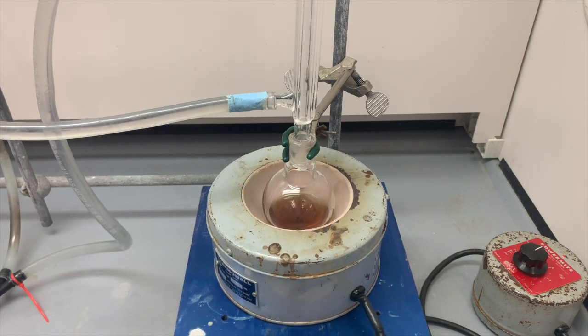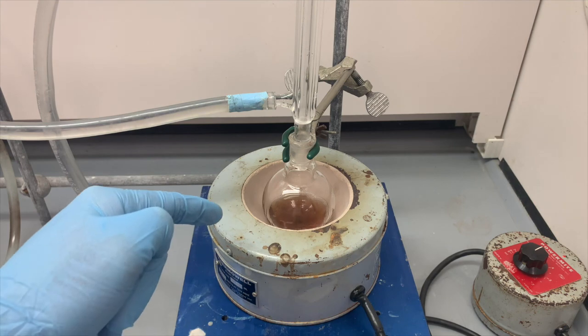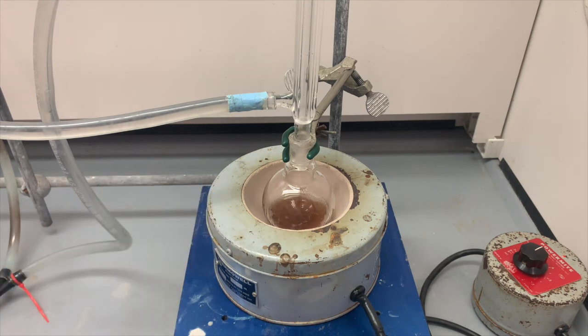And our SN2 reaction will happen now. We're going to let this reaction stand at reflux for about an hour. You can see the thermowell was still hot, so as soon as it touches the flask, we have reflux occurring yet again. We will come back and check on this reaction in an hour. Of course, we are keeping an eye on it to make sure it stays safe.